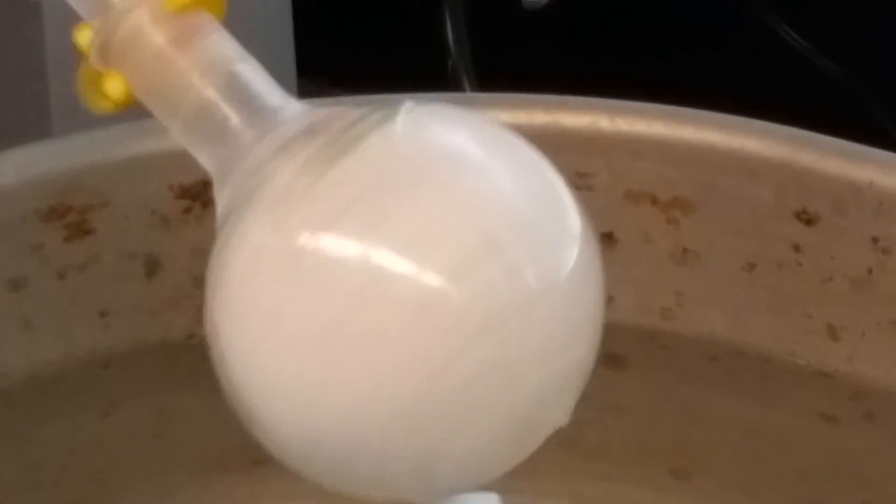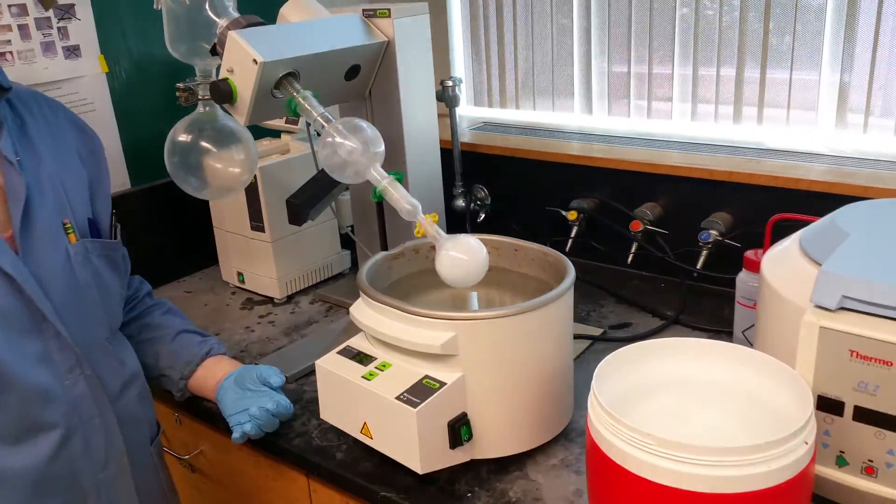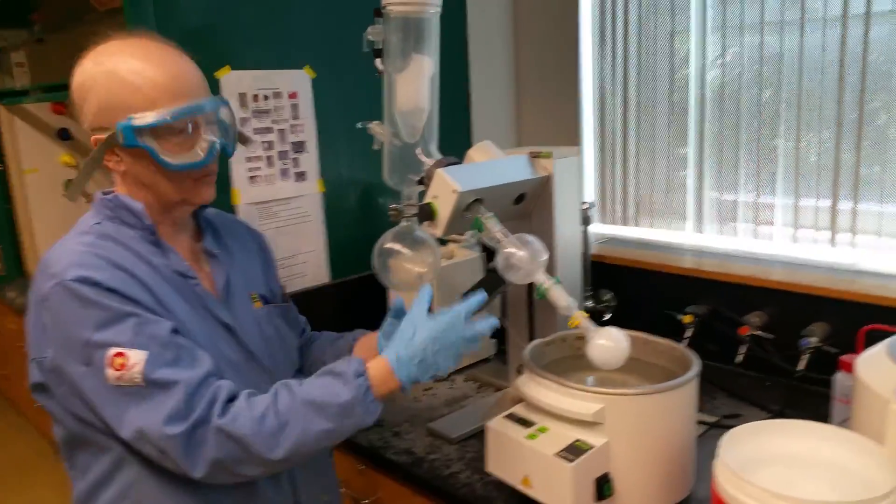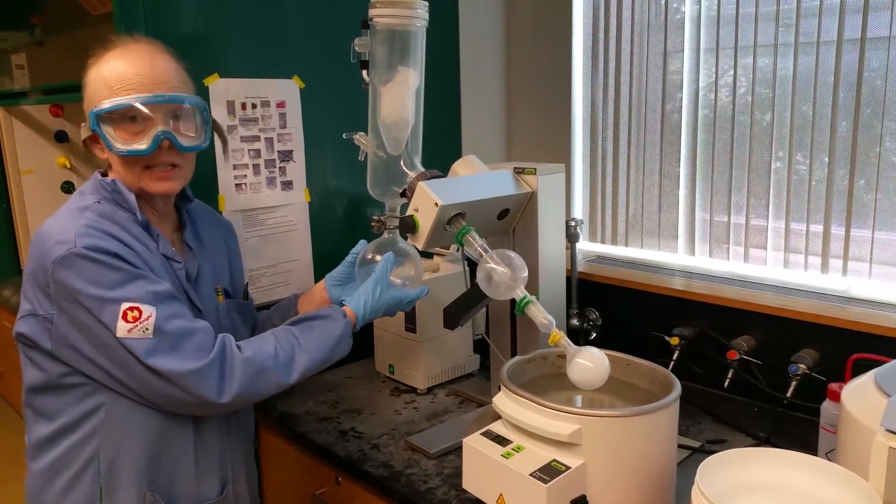The goal is to get what's in the pot and get it dry. And why is it that I can go to dryness? Because I'm not heating it very much. If I'm not heating it very much, I'm not going to form peroxides, or it's very, very unlikely. So an explosion is very unlikely. Now this has been going a little longer, and you can see almost all the solid is gone, or almost all the liquid is gone. It looks like a solid shell. That's the umbelliferone, the 4-methyl-umbelliferone.